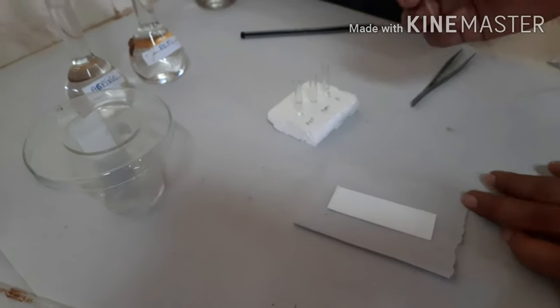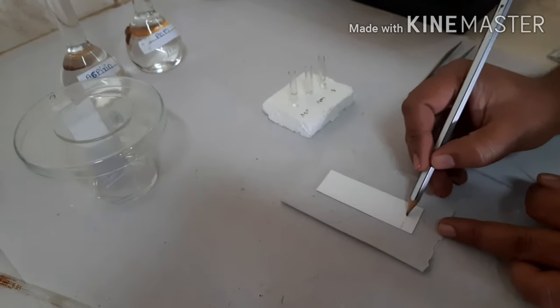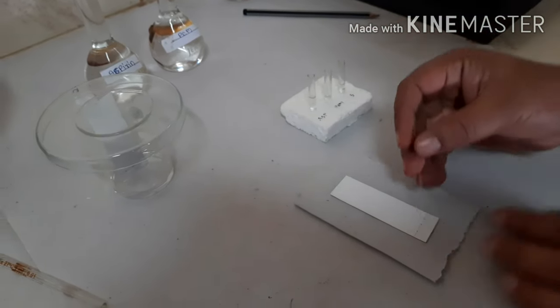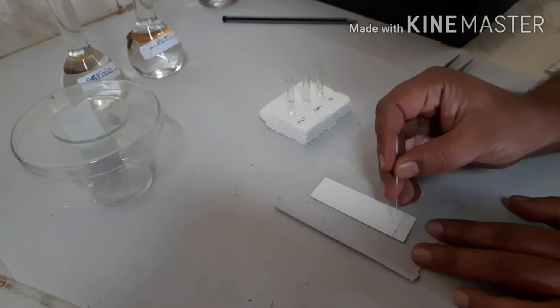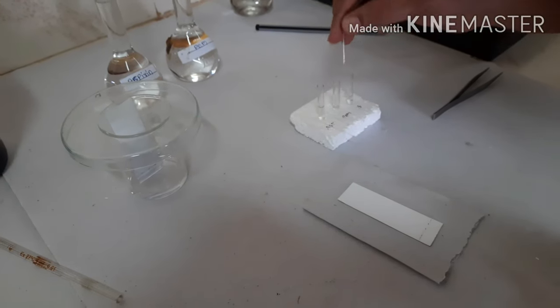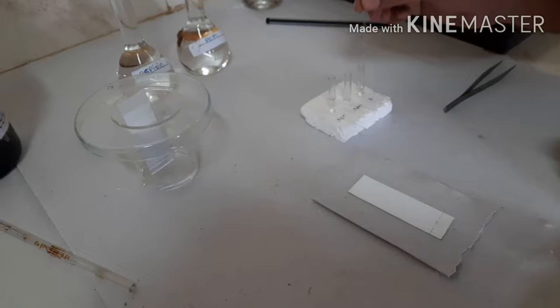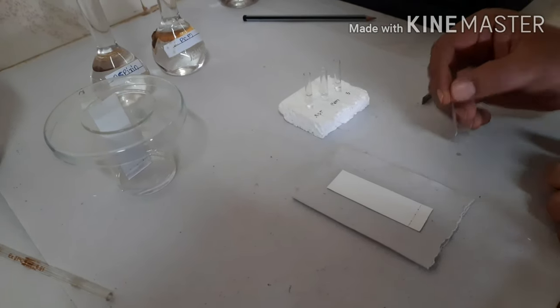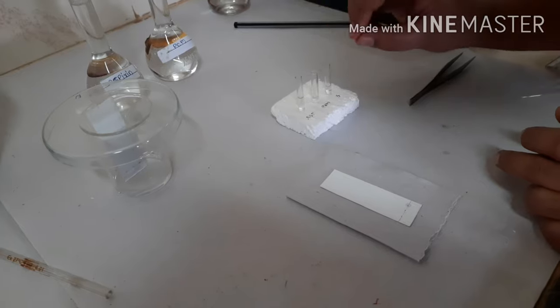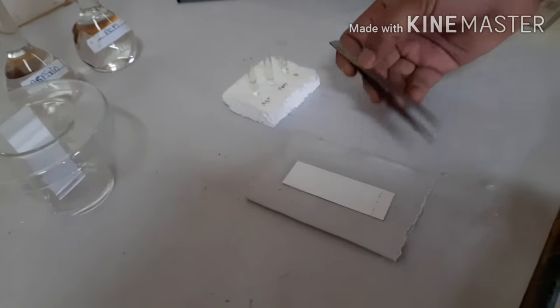Now demonstrating on the TLC plate with marked spots: the first position is for aspirin standard, which has been spotted. Using a separate capillary, the next standard — paracetamol — is spotted at the second position. The third is the unknown sample, which we are going to identify using this TLC. Sample spotting is done and we allow the solvent to evaporate, which takes about a minute.